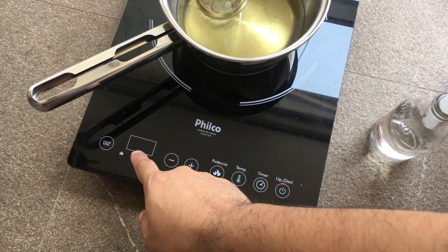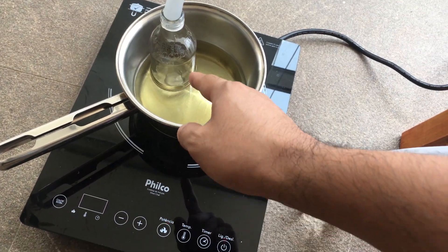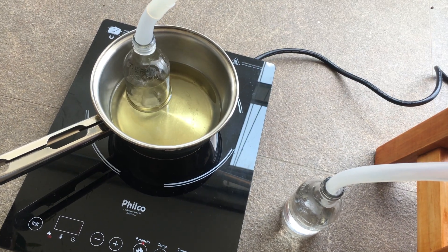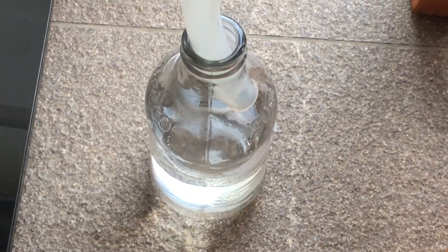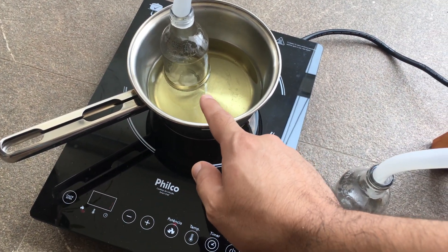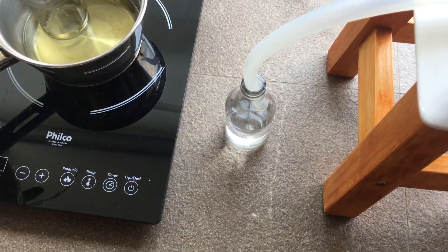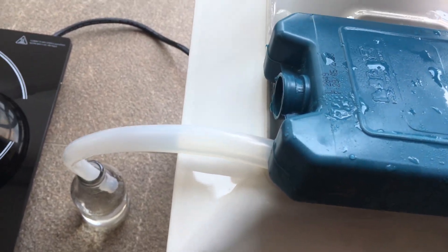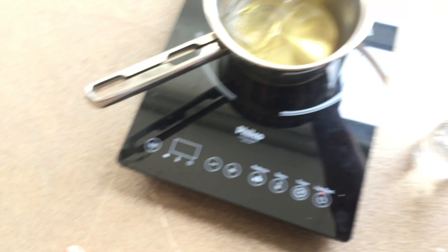Next time I'll keep it at a lower heat, keep it at one, since initially there was a lot of bubbling and overheating. Now it's gotten down and the distillate has stopped coming over at a fast rate, so I'm going to stop this to prevent excess impurities from coming over. The distillate comes over pretty fast — it pools a little bit in the front, then cools down and comes over.